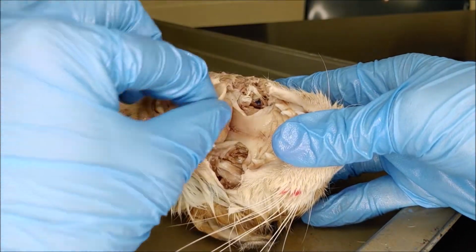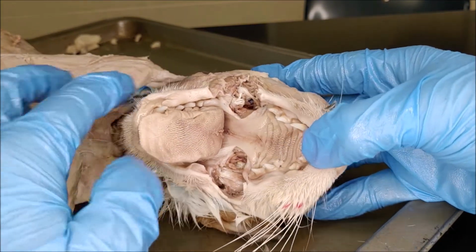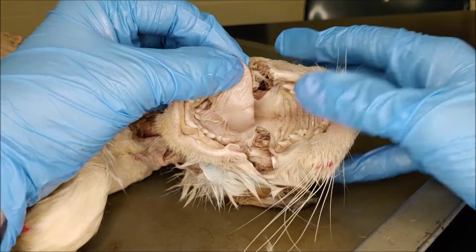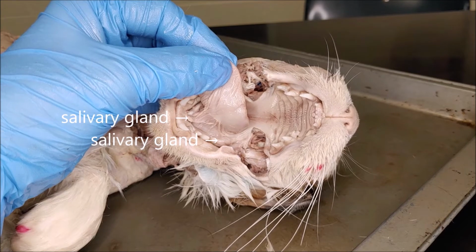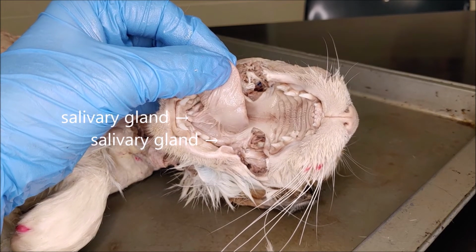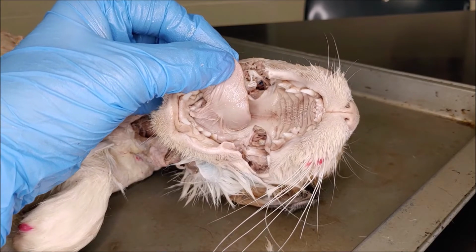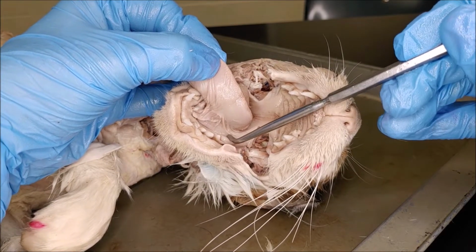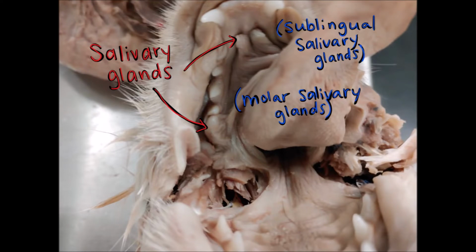All right, so we've already broken this cat's jaw so that we can get a good look inside the oral cavity. The first things that I will point out are the salivary glands, and unfortunately I did not do a very good job of pointing this out, so here are some little arrows pointing to them. There's two little buds sort of near the frenulum of the tongue. Those are the sublingual salivary glands, and then back by the molars you can see the molar salivary gland right here.